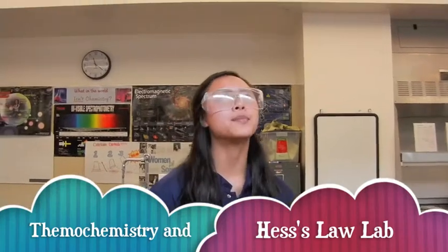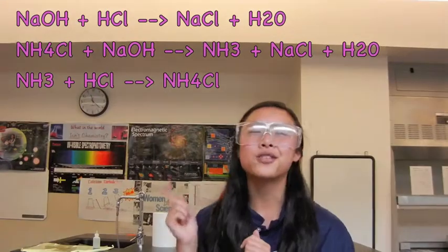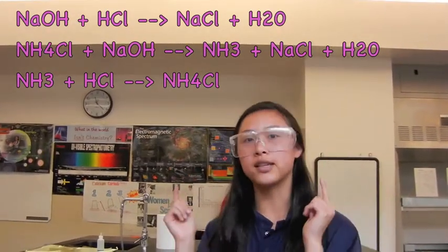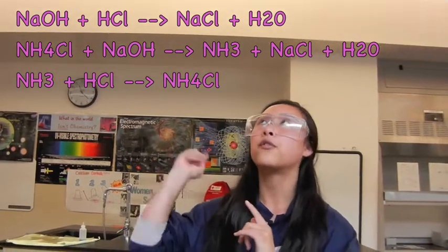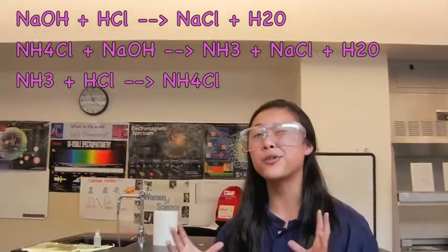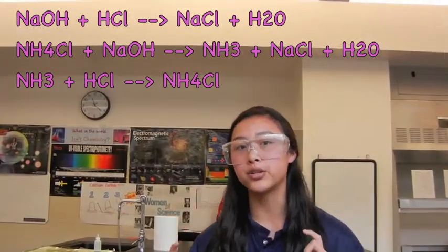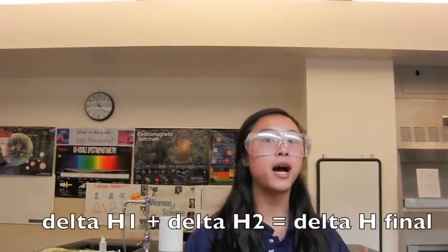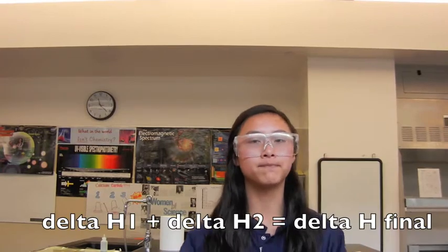Chem students, today we're going to work on thermochemistry and the Hess's Law lab. The purpose of this lab is to demonstrate Hess's Law. As you can see from the three equations above my head, we are going to test the enthalpies for all three of these. The first two equations algebraically combine to form the third equation. So, according to Hess's Law, the first two enthalpies should combine to form the third enthalpy.